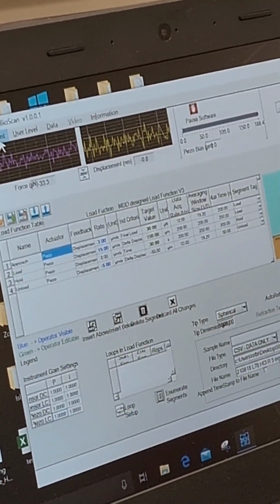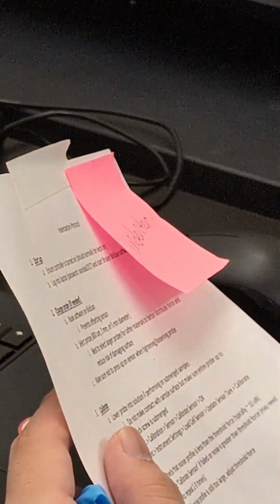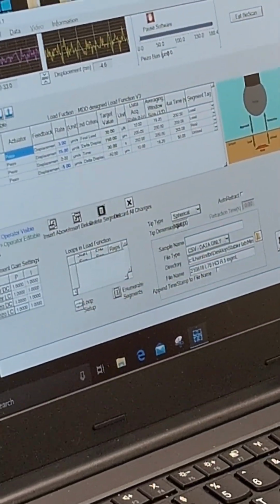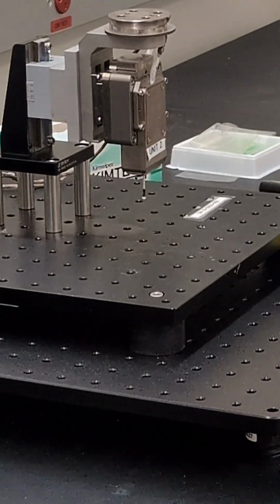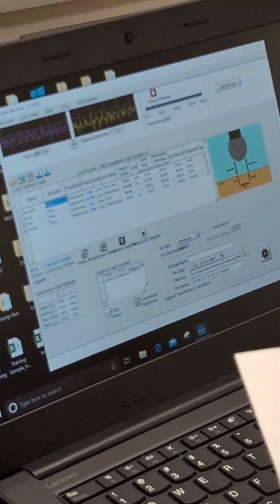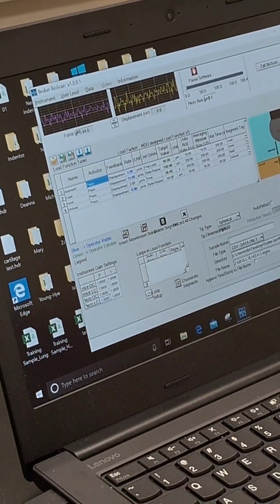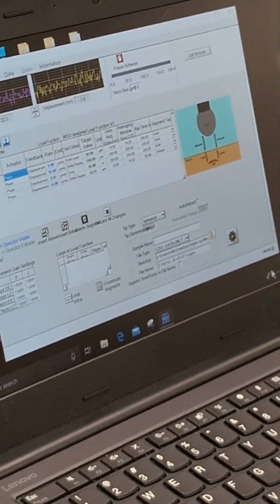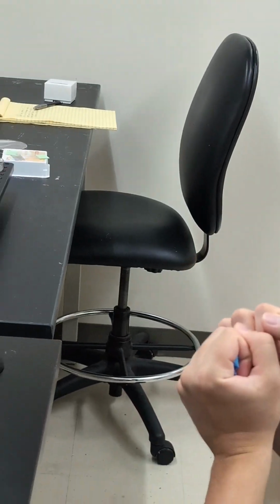That means when you do the calibration, you have to do the calibration submerged. It will detect and record buoyancy, especially when it has given a downward thrust. That means all the positive force is actually going downwards, or the negative force going upwards. Sorry, the other way around. All the positive force is actually going upwards, or the negative force is pulling downwards. When the probe surface starts to get in contact with the hydrogel, the first force it experiences is actually pulling, it's not pushing up.